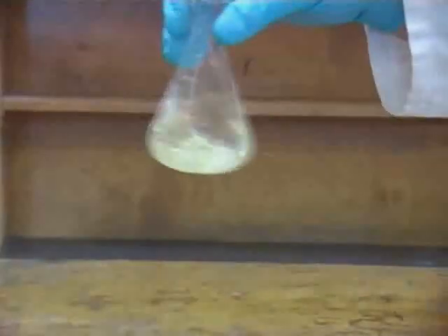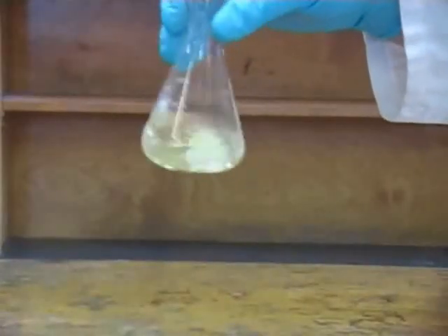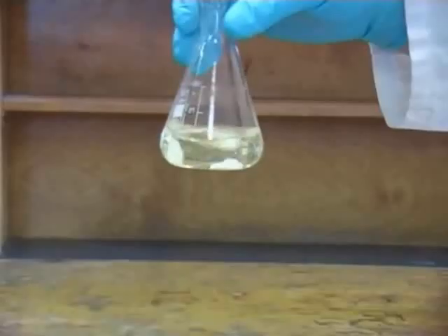If the drying agent forms clumps as shown here that's a sign that the solution is still wet and that more drying agent is required.